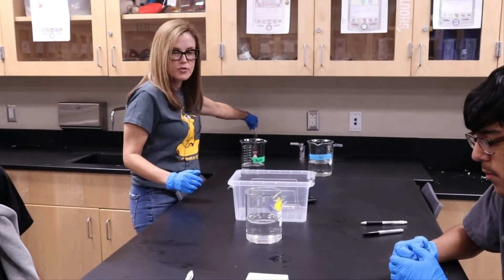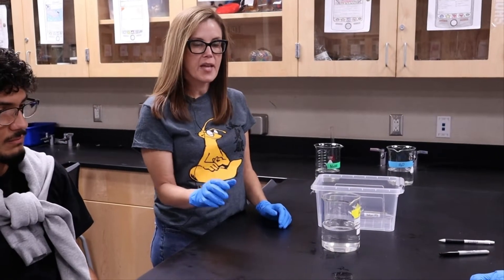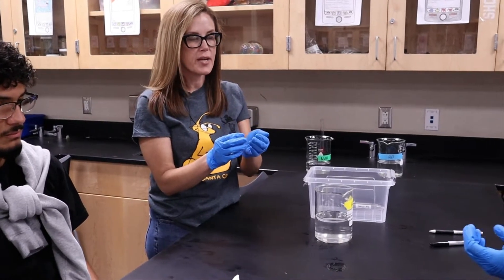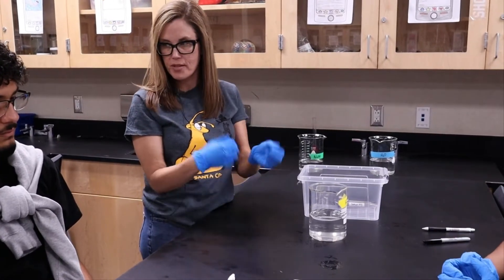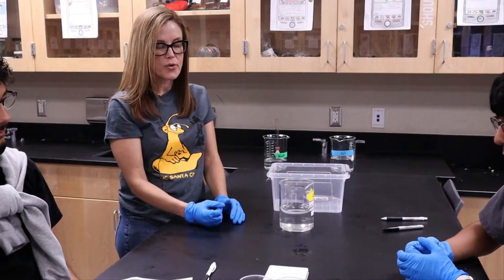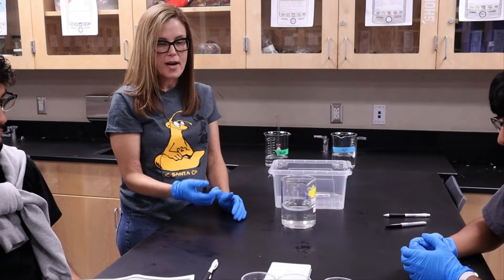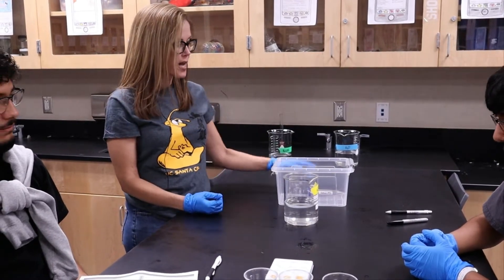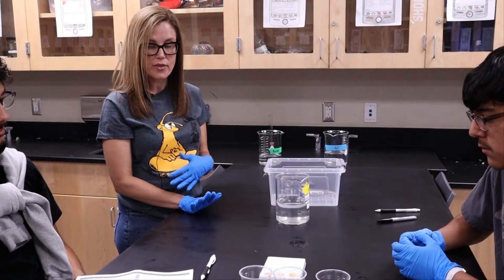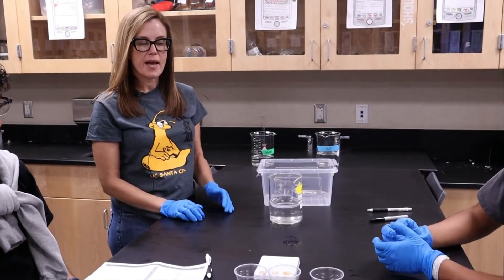So at this point we should be ready to go. The next step is to take the pill, scoop it out, and roll it between your thumb and your finger to create a coating. It's not going to be perfect — there will be little chunks, don't stress. You want to get as much around it and as evenly as possible. We're going to do all three, then put them in the cups at close to the same time. We can each do one so we can do it at the same time.